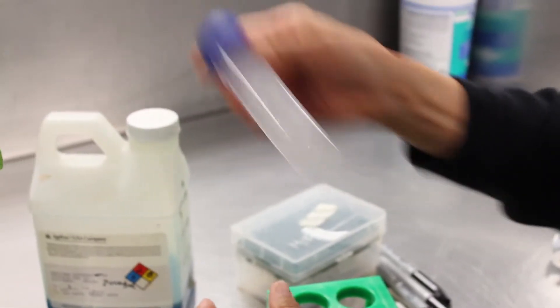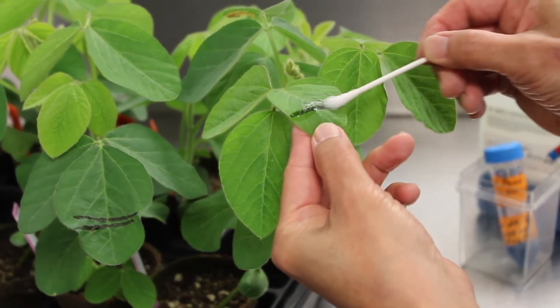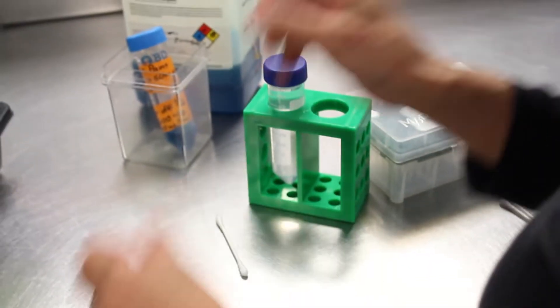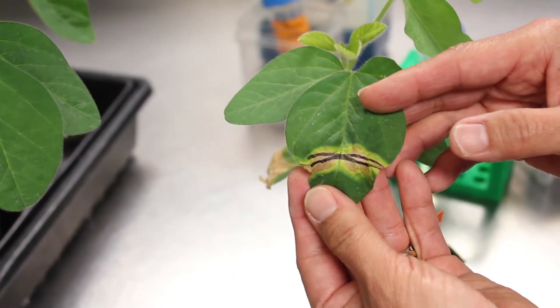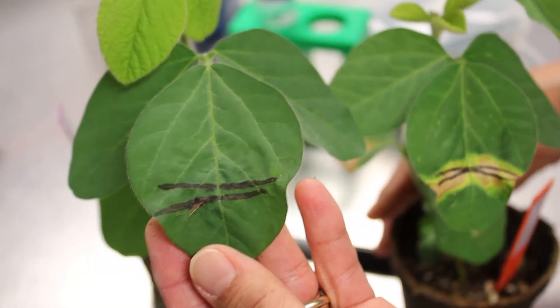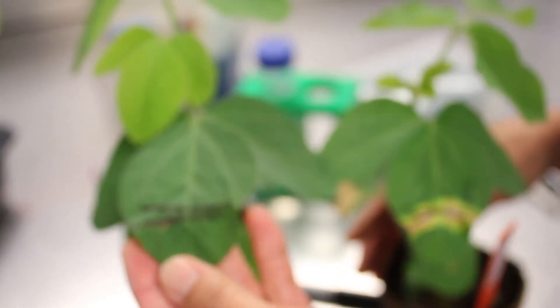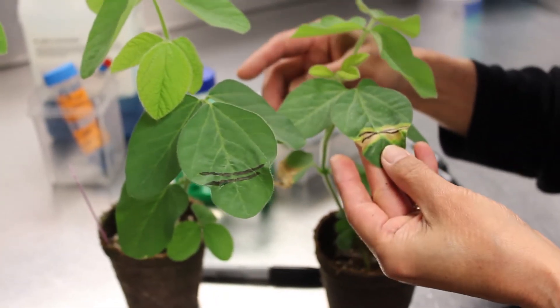Now I'm going to apply this herbicide to the soybean leaf. In five to seven days after application, if the plant does not contain the herbicide gene, the leaf will look damaged. You can see there's no damage on this leaf, so this plant contains the new gene — the selectable marker gene, the bar gene — and also the gene of interest. This other plant does not.